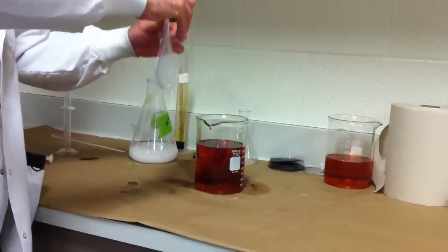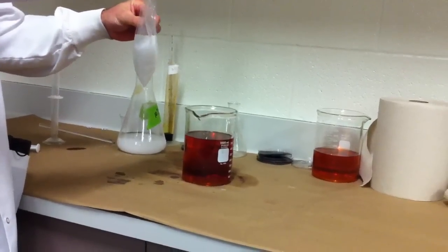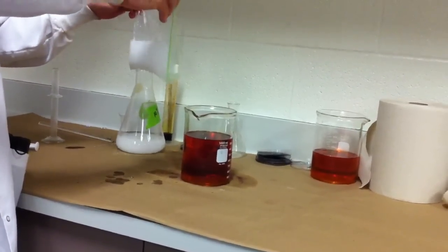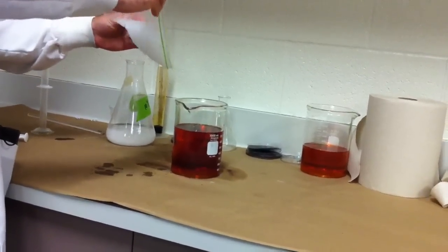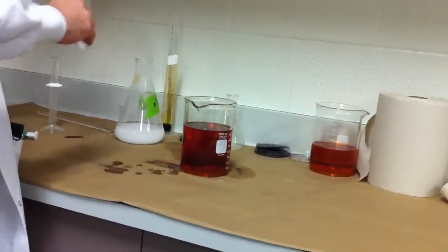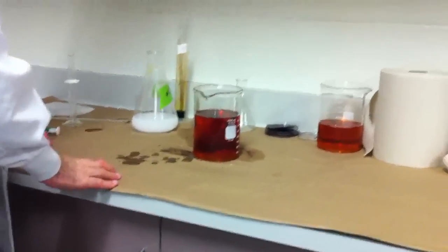Is it leaking? Is it? Yep. Or did I just squeeze it over the top? Yeah, no, it's leaking. It's got a hole in it. That's not going to work. We need to grab another bag.